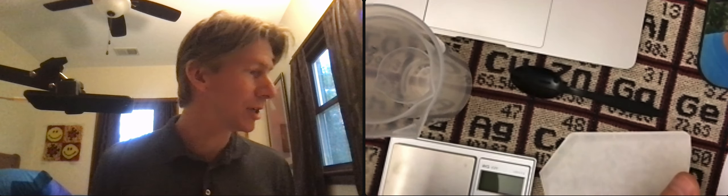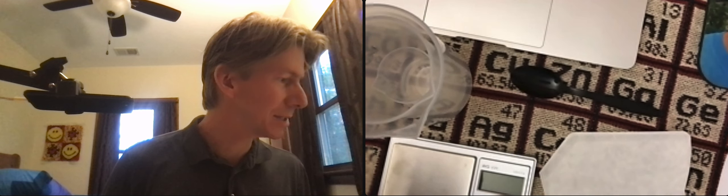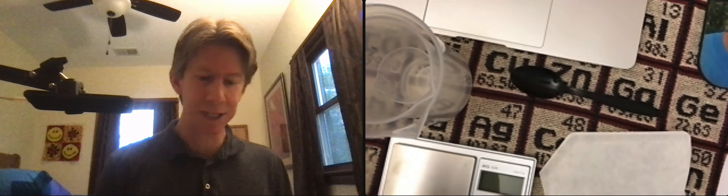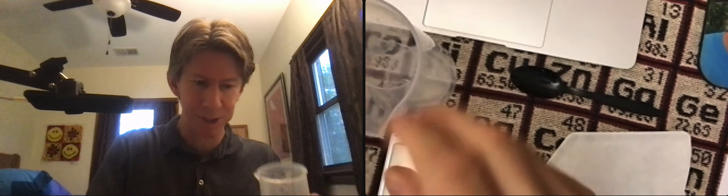Let's go ahead and start with preparation of the sample. For preparation of the sample it says record the mass of a clean and dry 250 milliliter plastic beaker. Again the exact size doesn't matter but that's what I'm using.